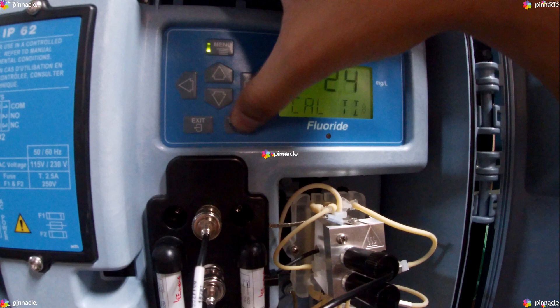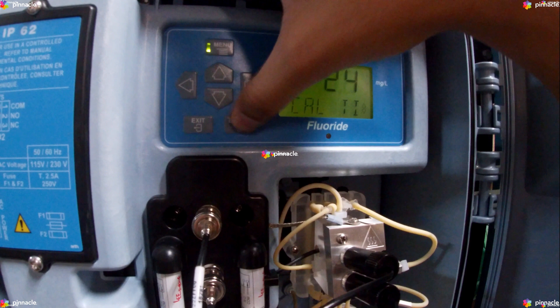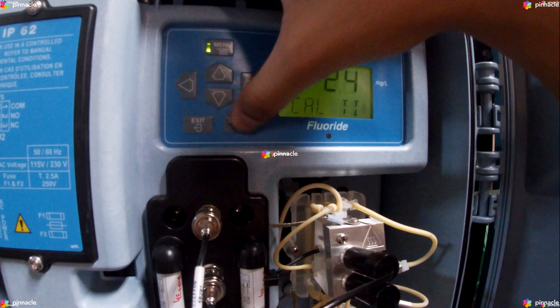The CalPart1 option is used to set the value of the drift of the electrode since the previous calibration. The CalPart2 option is also used to set the value of the drift of the electrode since the previous calibration.